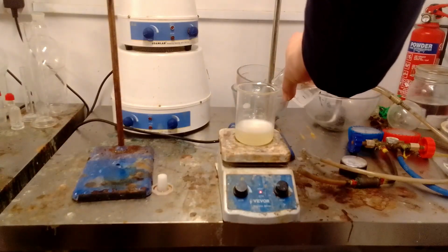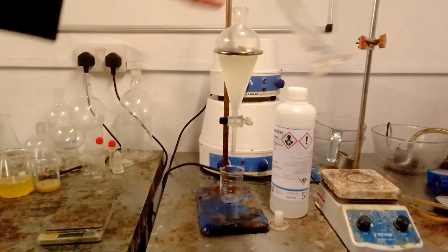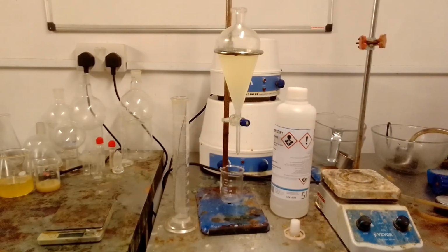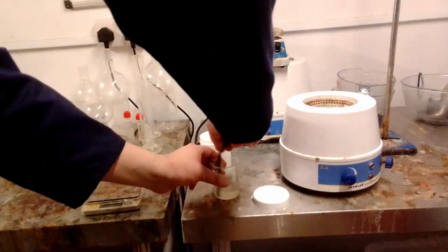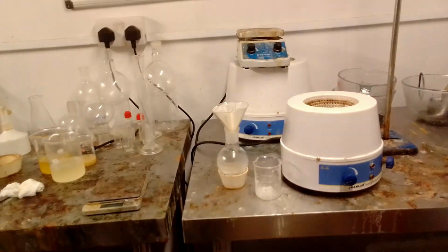The aqueous phase was neutralised with a 40% potassium carbonate solution, then extracted with 3 15ml portions of DCM. Because I was working with such concentrated salt solutions, DCM became the top layer, which took me by surprise at first. These were dried with sodium sulfate and filtered, then the solvent was removed by distillation.